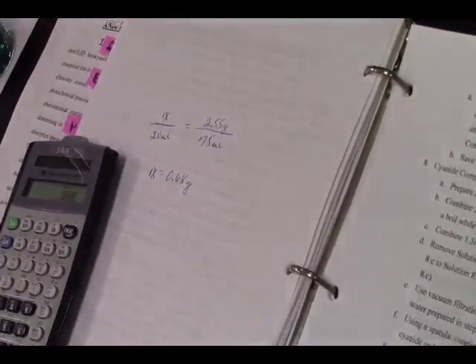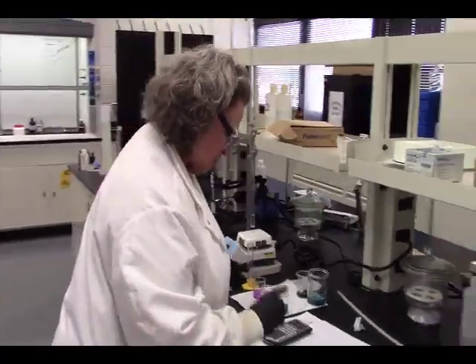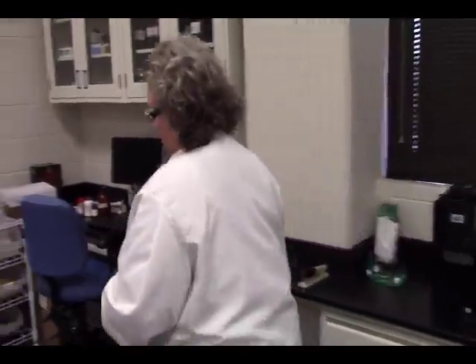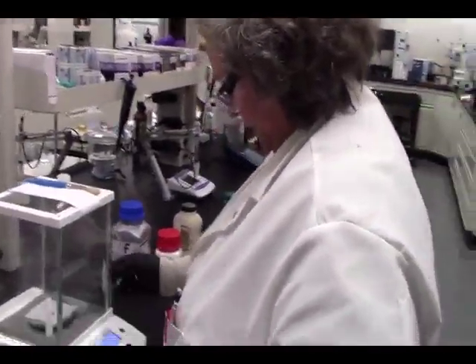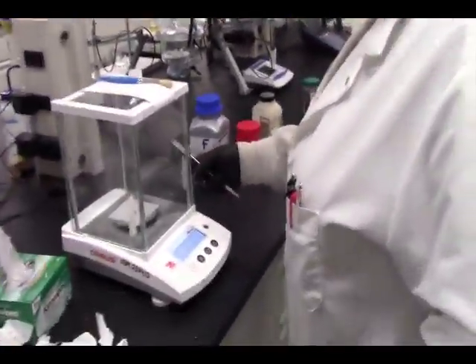Is that logical? We have less than half of this volume, so we have less than half of this mass. Logical. If you want to check your math again, do so. So we need 0.68 grams of cobaltous chloride, and we're going to put that in 20 mils of water. Always make sure your numbers are logical when you're working in lab. What would be an illogical number? If we had come up with something way low or higher than what we started with. That would have been illogical. We need 0.68.